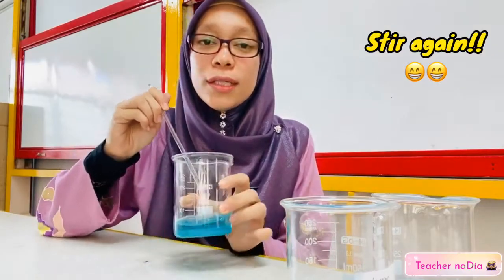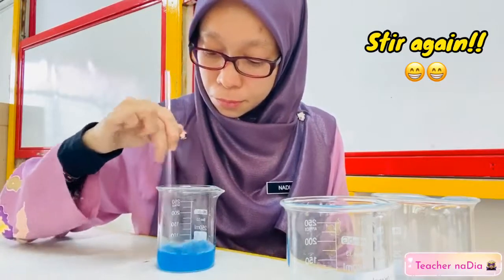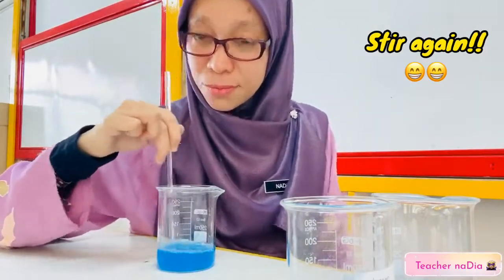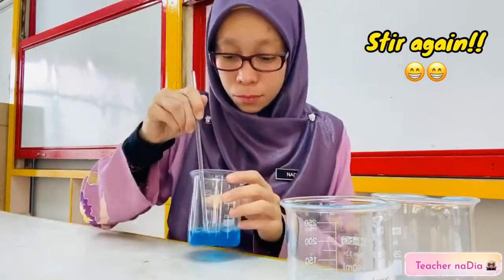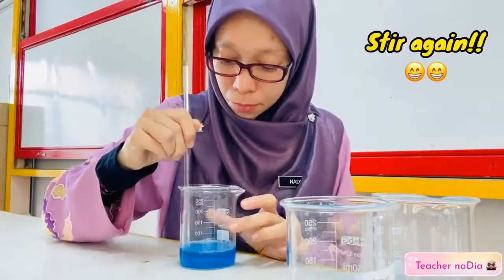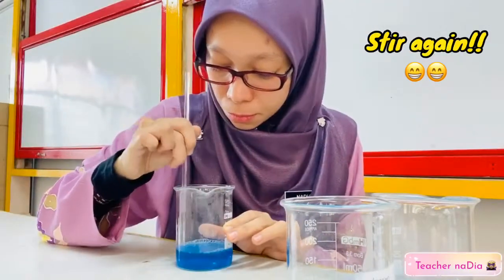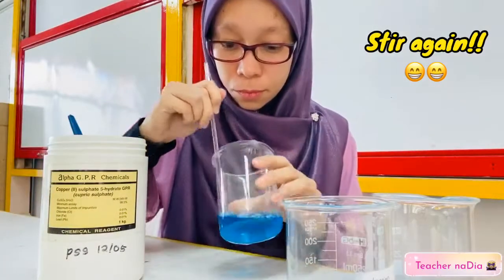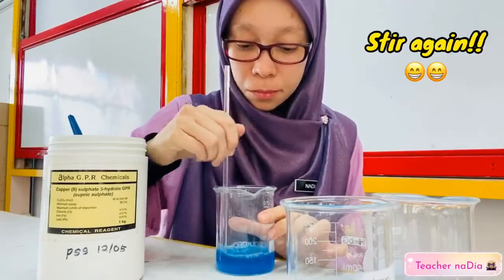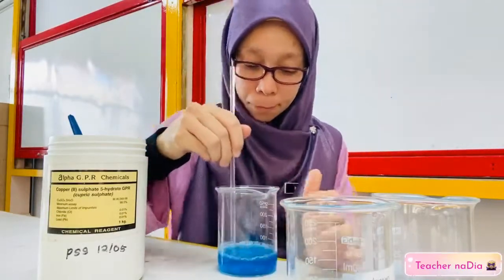Now we stir it until all the copper sulfate crystal dissolves.